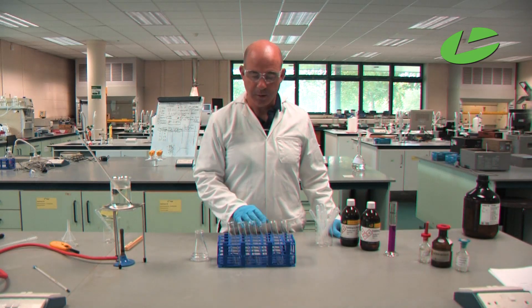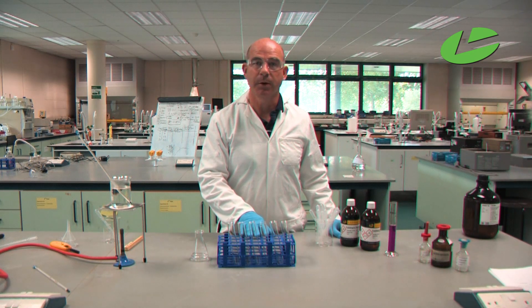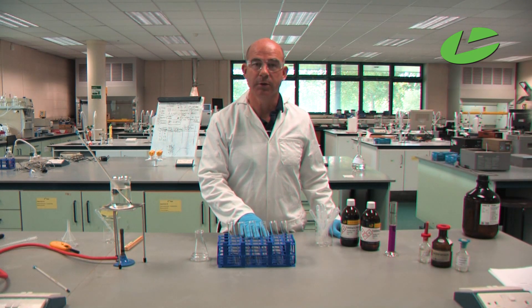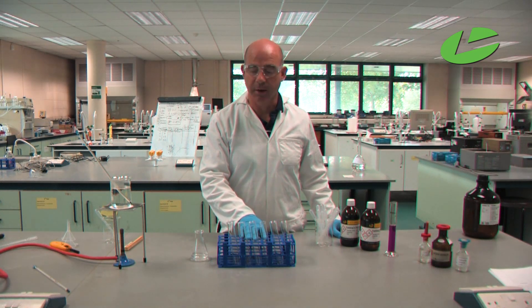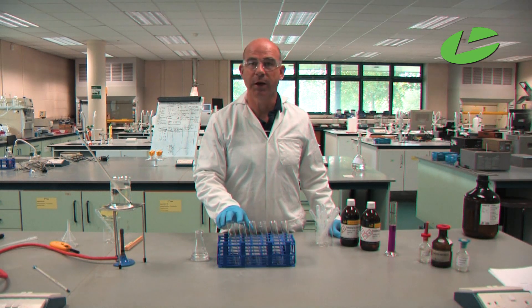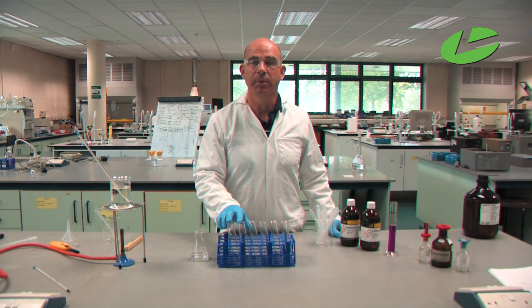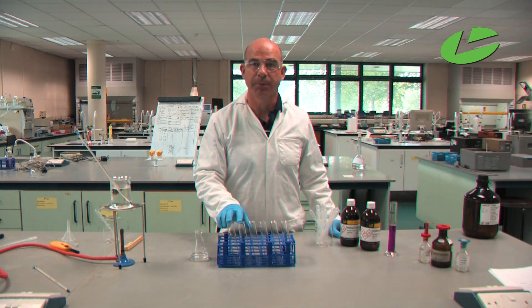Here I have my six test tubes in front of me. I'm going to make two solutions of Fehling's solution, two of acidified potassium permanganate, and two of Tollens' reagent. One will be used as a control and one will be used to see the colour change in the reaction.